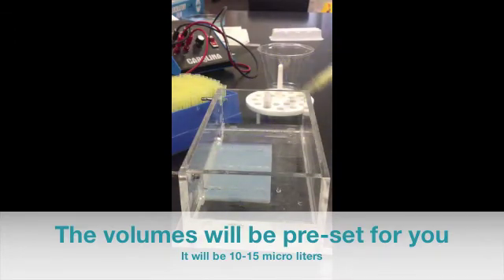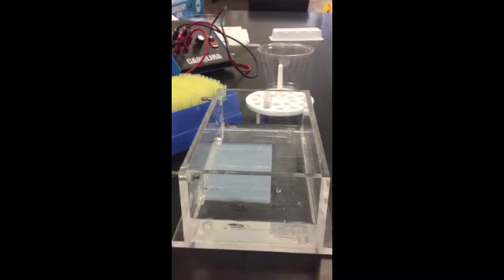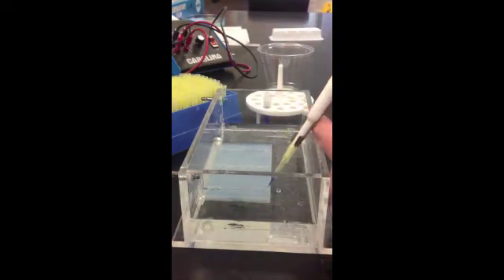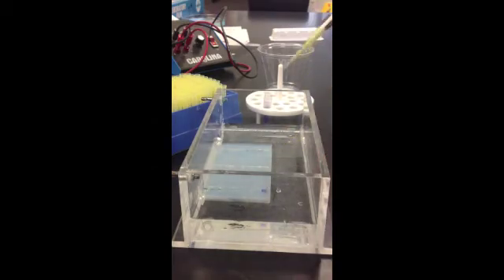And I need to load it into one of these wells within this gel. So I like to use my free hand to kind of guide it into the proper well. Make sure you're in the well, but you don't want to puncture it. So you just want to be hovering inside of the well, and you're going to release your liquid, remove it, and then you could let go of the plunger. I'll do that a couple more times.